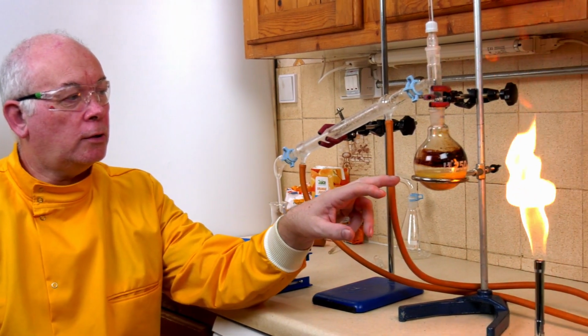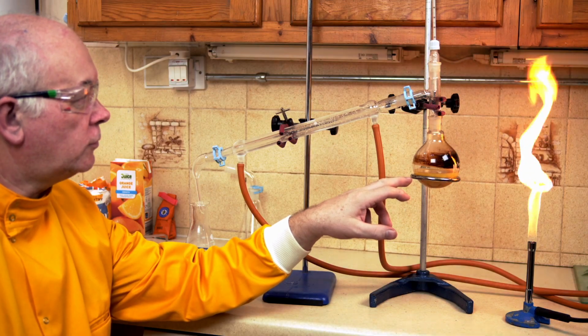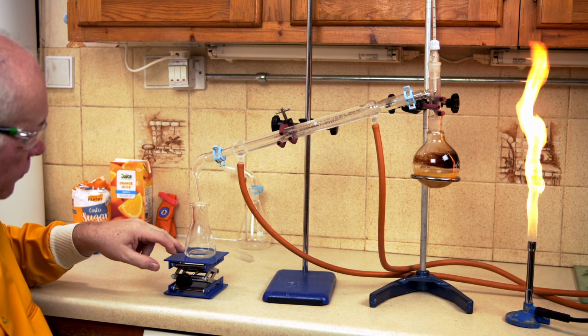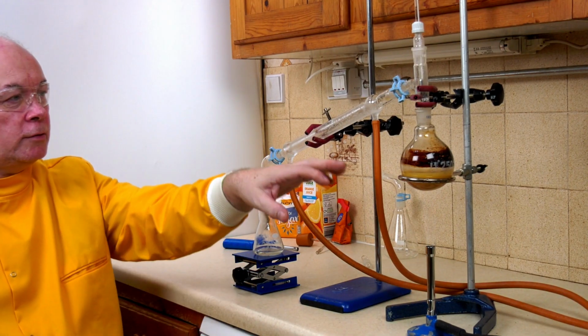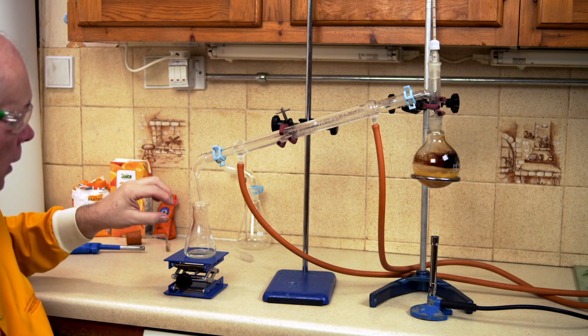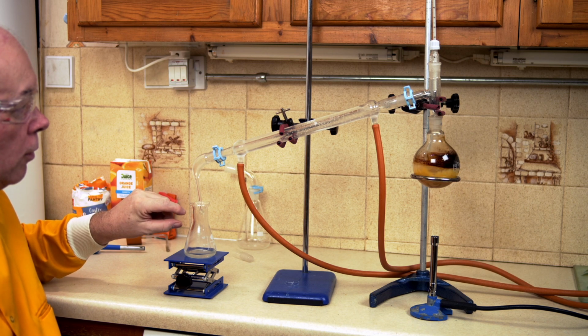In this experiment, I want to have a look at distillation. I've got in here a mixture of orange juice and alcohol, and what I want to do is distill off just the alcohol down into this flask here. So by heating this, we're going to manage to separate the alcohol and the water and produce just alcohol down here. Let's have a go.